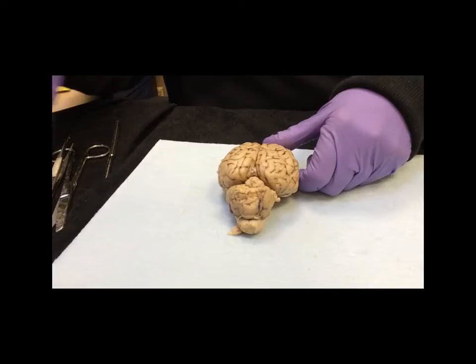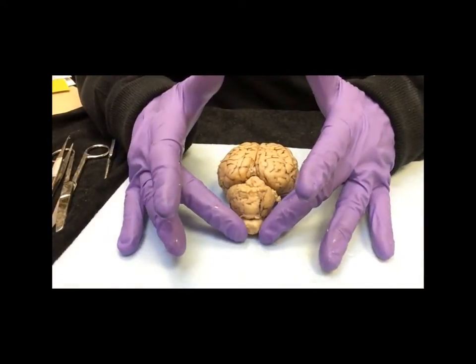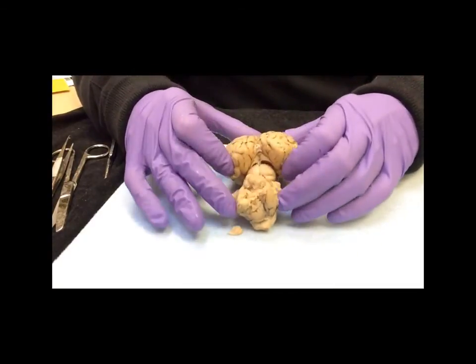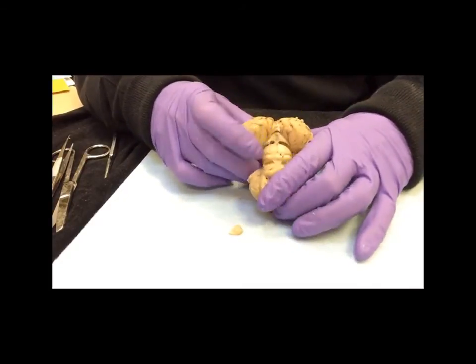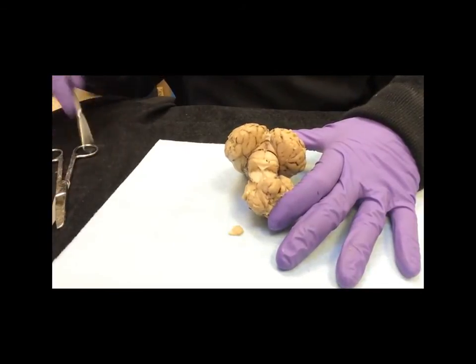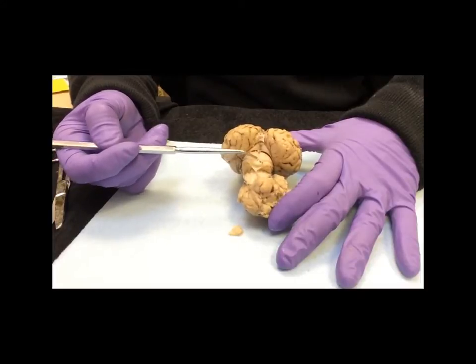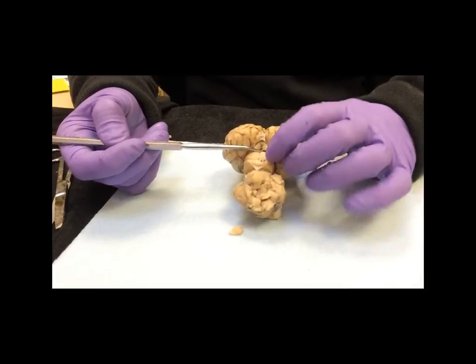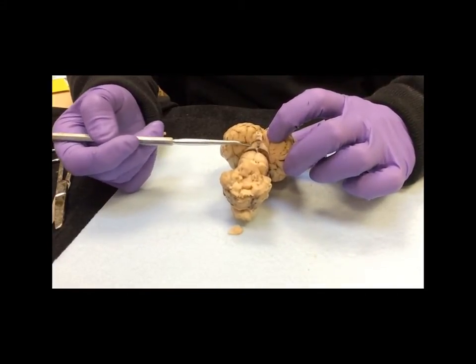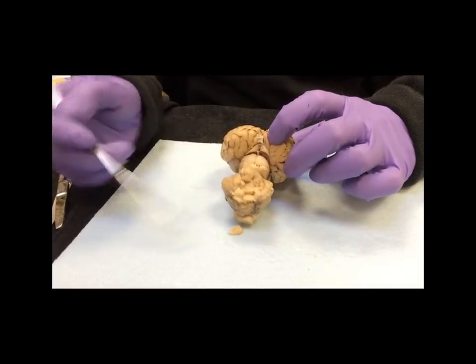In step 6, we are again at the caudal end. Here's the cerebellum, here's the cerebrum, there is the medulla, and what we are going to do is just bend the cerebellum back and reveal the superior and inferior colliculi. Here is the superior colliculi, and there are the inferior colliculi. And you can see here, again, if you pull it, that there is some of that arachnoid, spidery meninge in there. So we have superior and inferior colliculi.